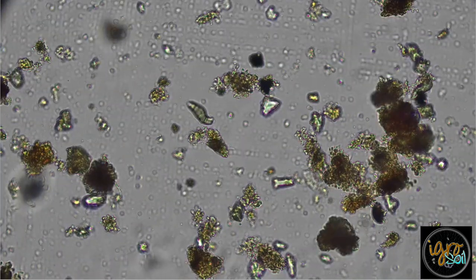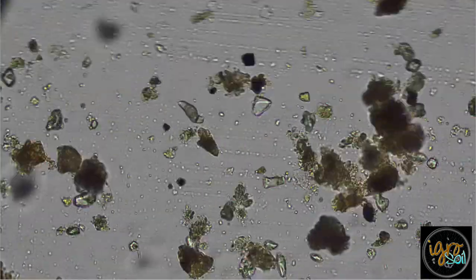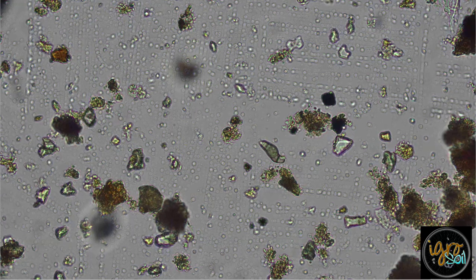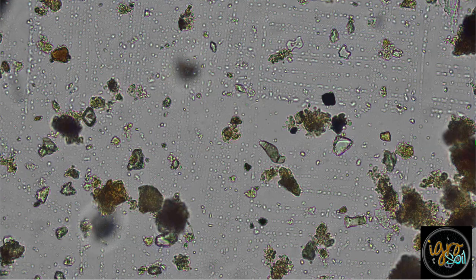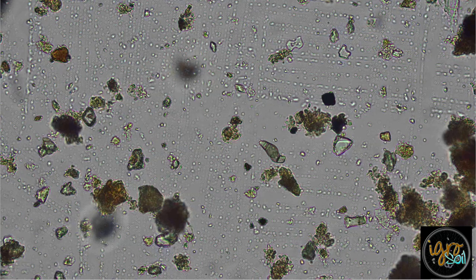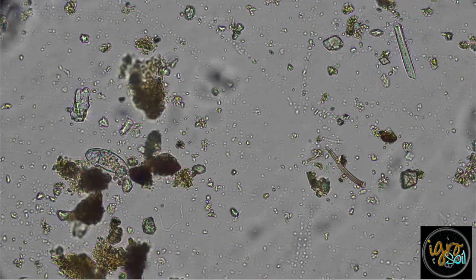Remember, they cause root rot. Look at this. Well, that's interesting. That's a spore. And then I don't even know how Fusarium does spore. I don't know how that works, but maybe I'll do a little more of a deep dive into Fusarium. But anyway, this is it, man. This is three slides. This is where we're at. You definitely need some biocontrol going on in here, and my advice to you is to get a couple of drenches going on. Soil drenches, heavy, to get rid of these guys. Otherwise, they're just gonna take over.